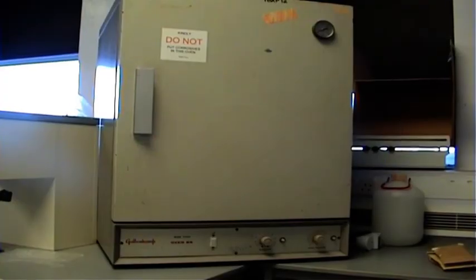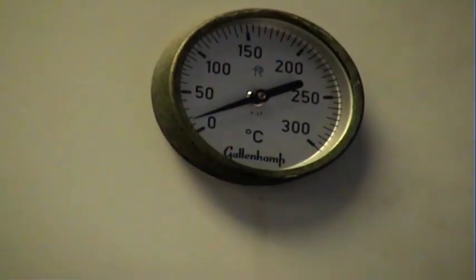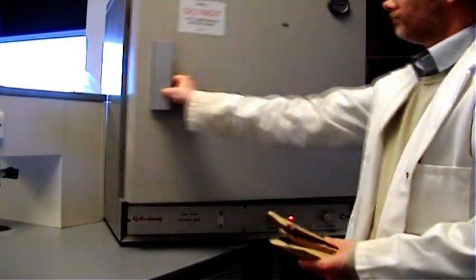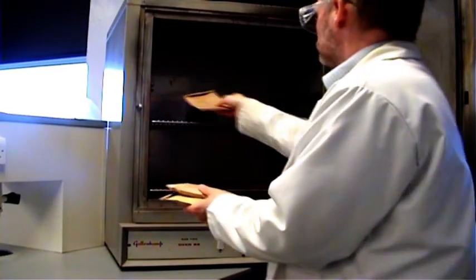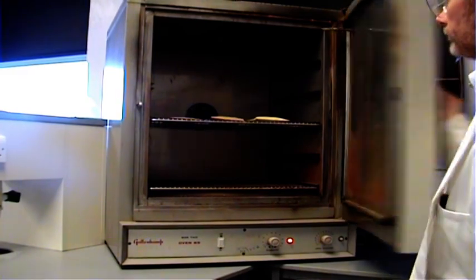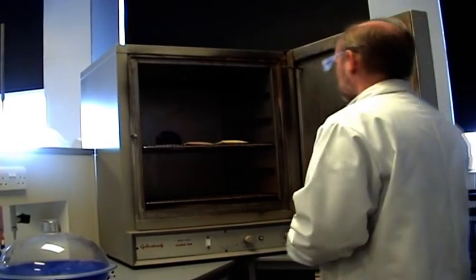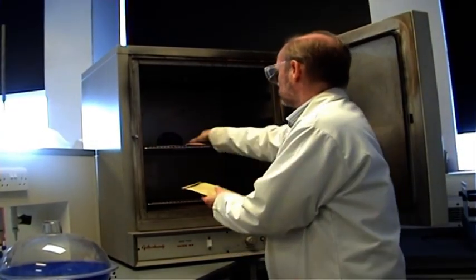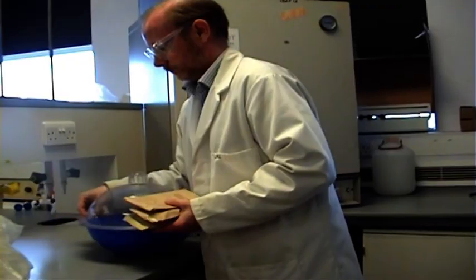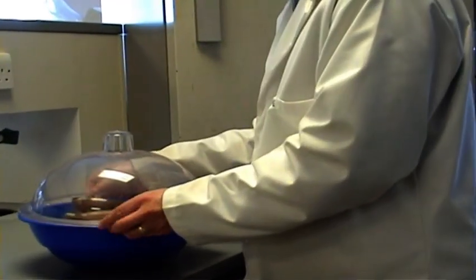The next step is to dry the sample in a suitable oven, in order to prepare it for the next stage. The temperature is chosen, usually between 40 and 105 degrees centigrade, to avoid loss of analytes of interest, while removing the variable water content. Samples are placed in the oven for periods up to 48 hours, dependent on the temperature and quantity of material. When dry, the samples are removed and stored in a desiccator until required.